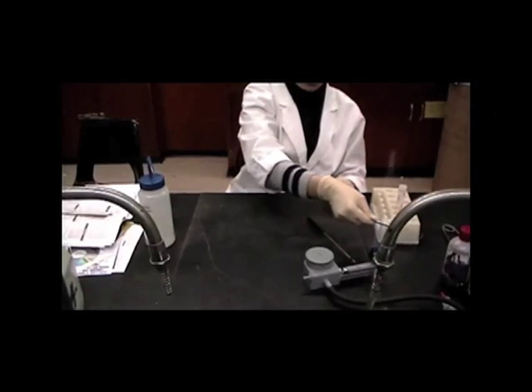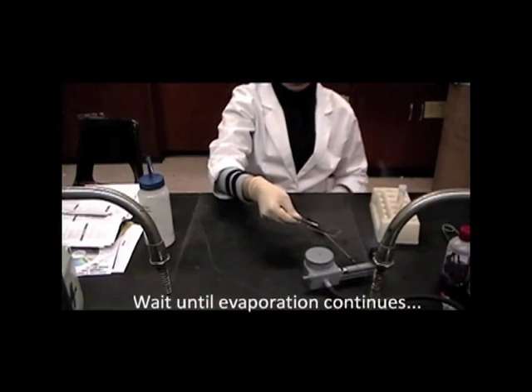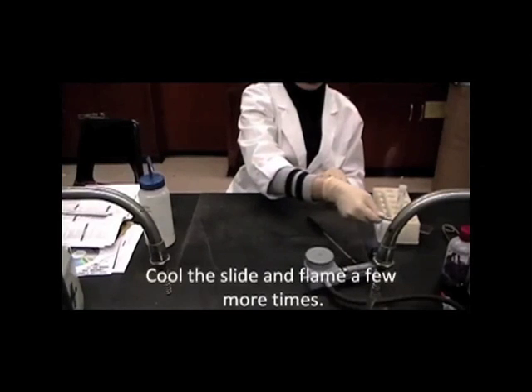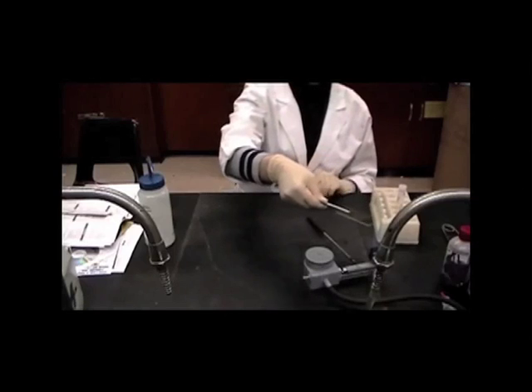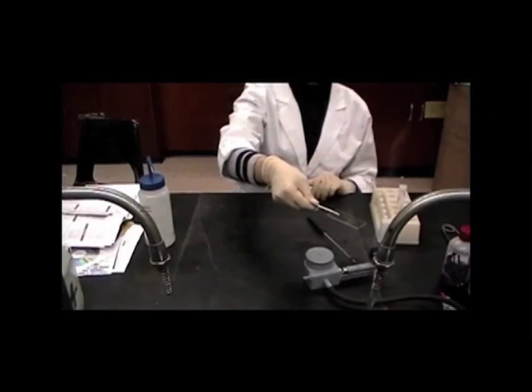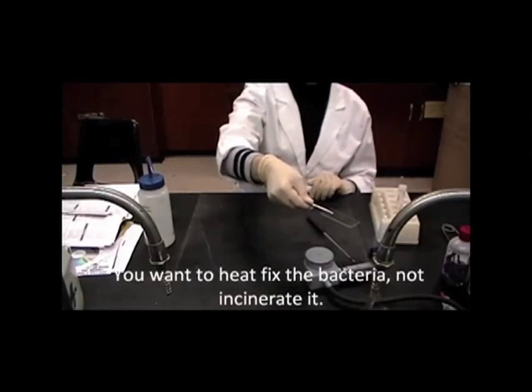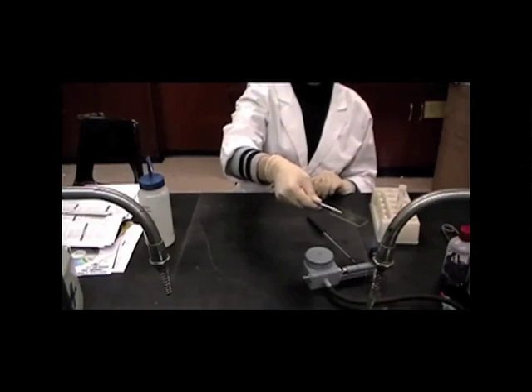Then one waits until evaporation continues. The slide cools, then you flame 2 or 3 times again. Again, 2 or 3 times in the flame. Wait until the slide cools. You don't want to incinerate the bacteria. You want to heat fix the bacteria. Heat fixing the bacteria refers to the drying of the bacteria, which then causes the bacteria to stick onto the slide.